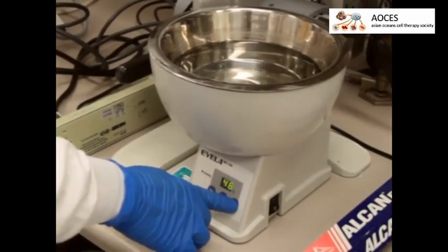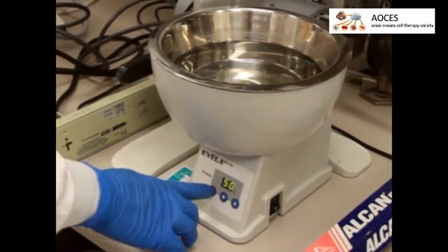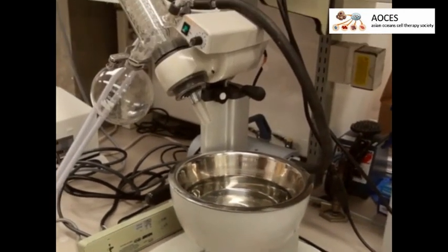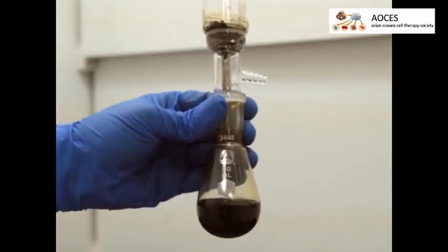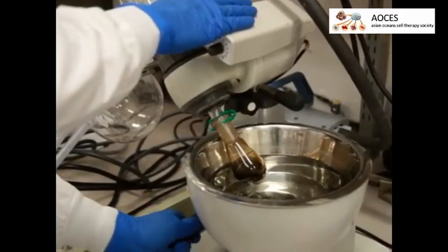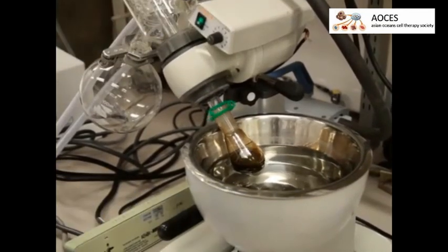Set the water bath temperature of a rotary evaporator to 50 degrees Celsius with 24 degrees Celsius water circulating through the condenser. Then transfer the filtrate to a 50 milliliter evaporating flask and evaporate the hexanes for 2 hours at a moderate rotation speed under vacuum.